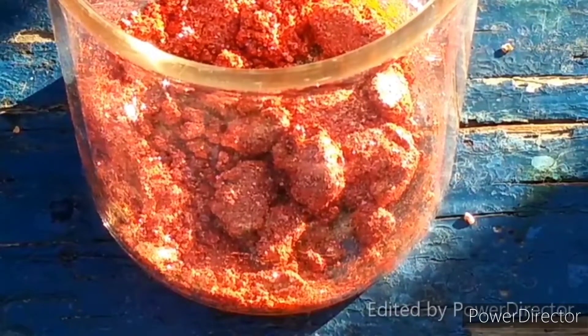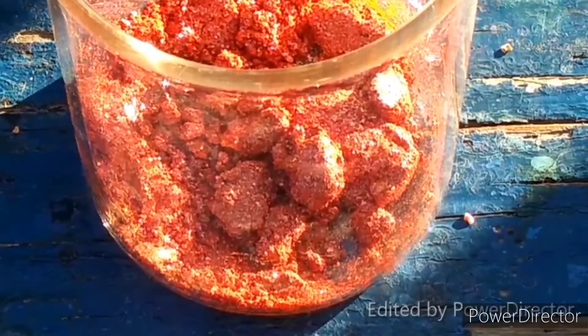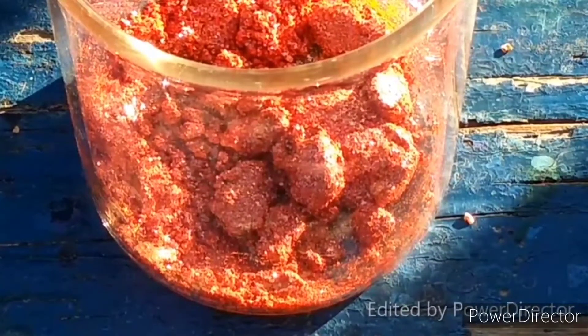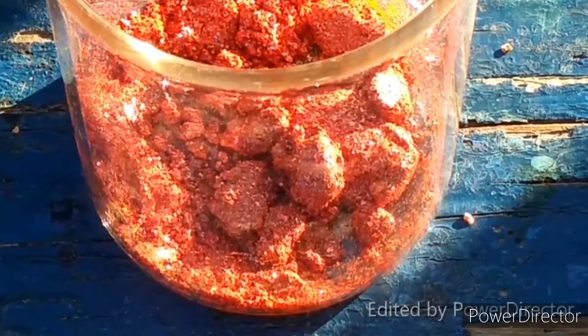It was this sky baby blue ugliness. I mean, it should have been Paris green. I think you have to use much less strong nitric acid if you want to make Paris green.